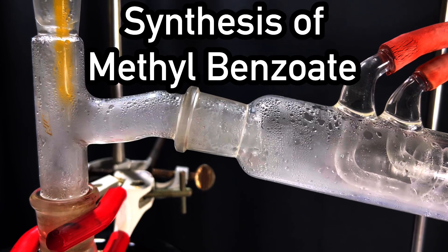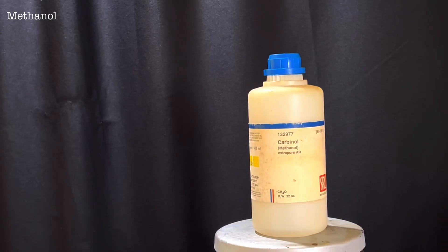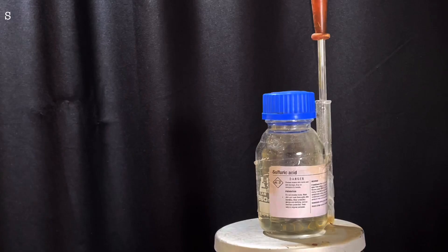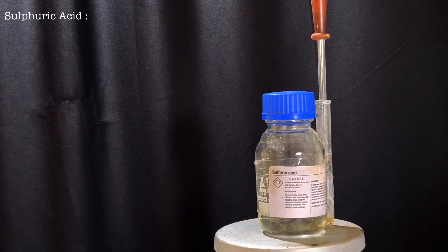For this experiment you will need 10 grams of benzoic acid, 30 milliliters of absolute methanol, and 1.2 milliliters of concentrated sulfuric acid.